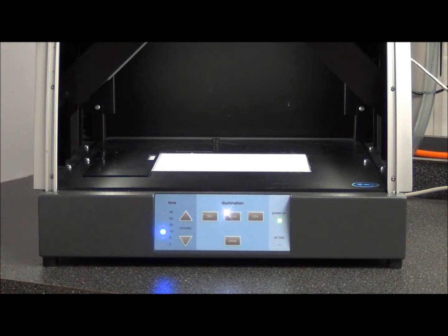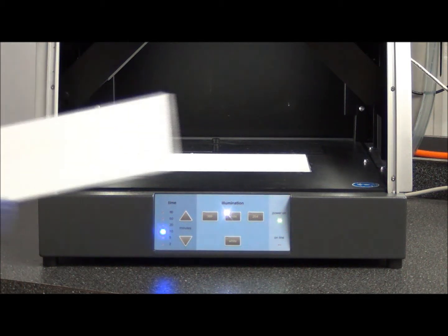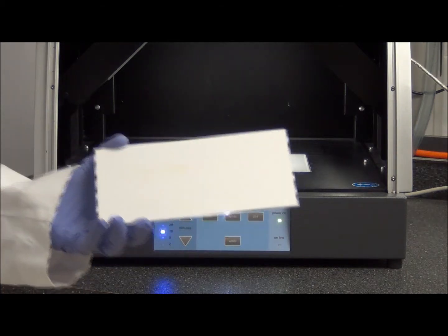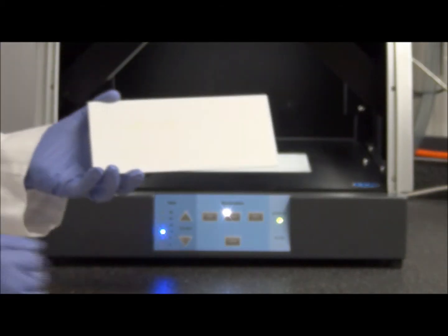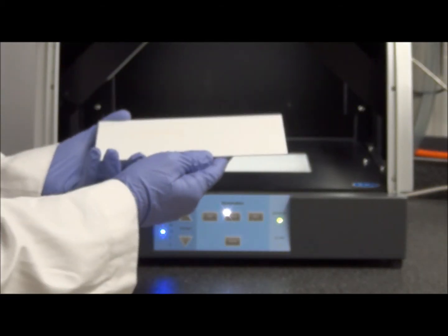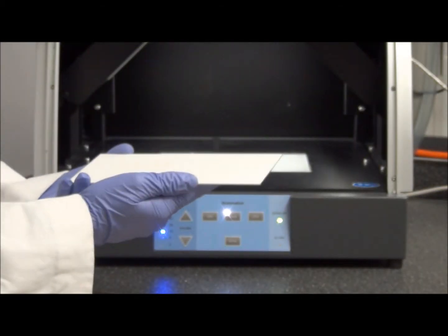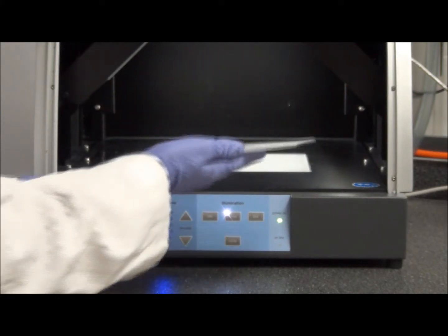The plate is now dry and I've removed it from the ADC-2. So now we have the plate and I'm going to insert it inside the visualizer so that we can acquire images after development.